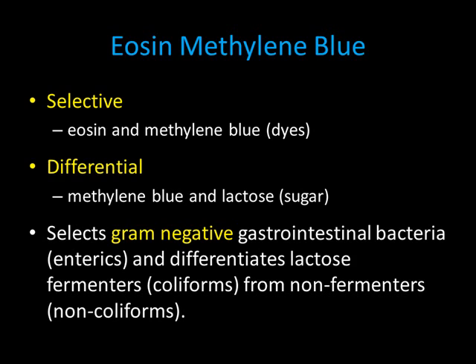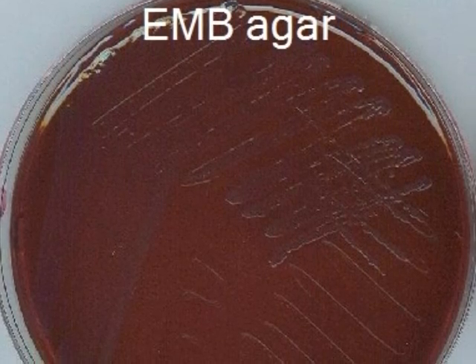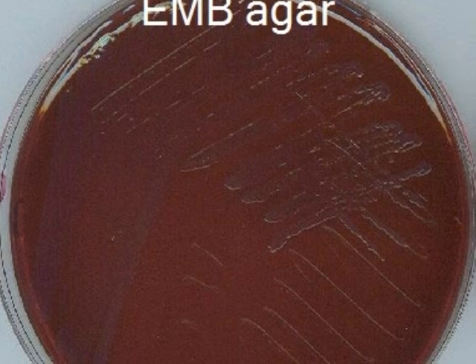The next selective and differential medium is eosin methylene blue agar. You should note the selective and differential agents listed here. Its purpose, just like MacConkey, is to isolate gram-negative enterics and to differentiate them based on their ability to ferment the sugar lactose. You'll notice in this picture of EMB that the medium is one consistent color.